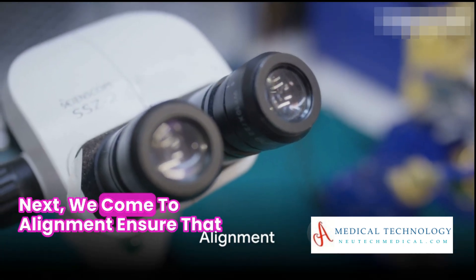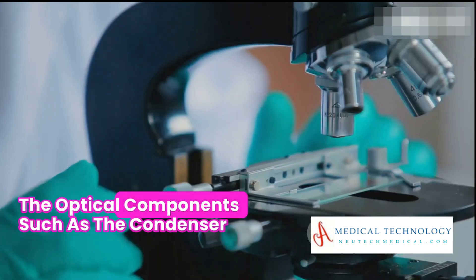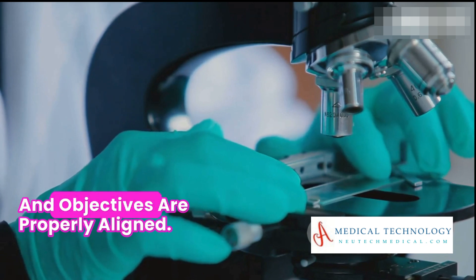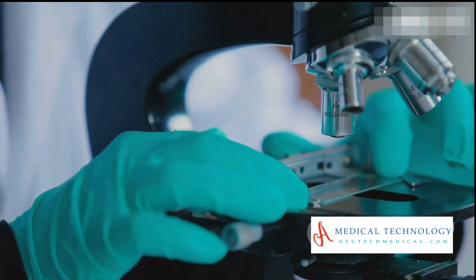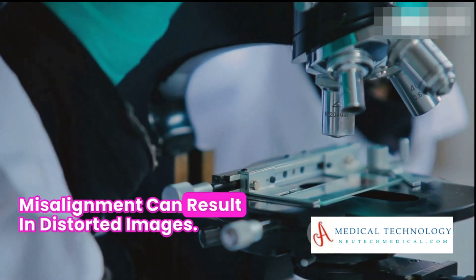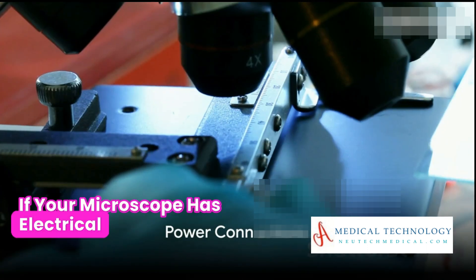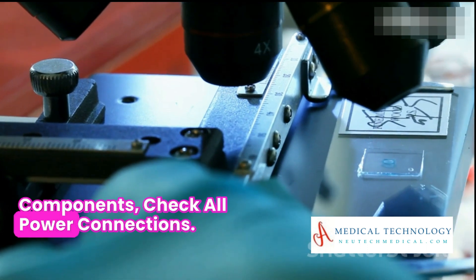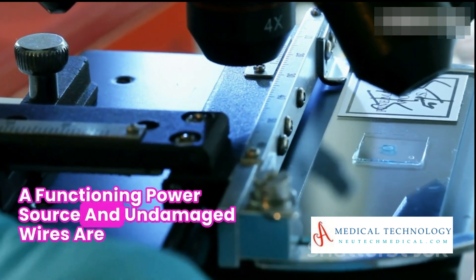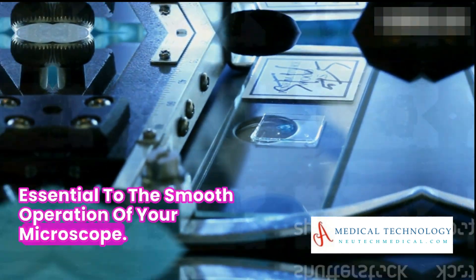Next, we come to alignment. Ensure that the optical components, such as the condenser and objectives, are properly aligned. Misalignment can result in distorted images. If your microscope has electrical components, check all power connections. A functioning power source and undamaged wires are essential to the smooth operation of your microscope.